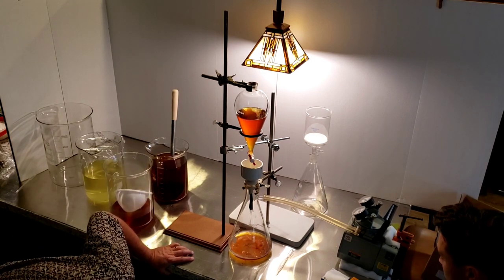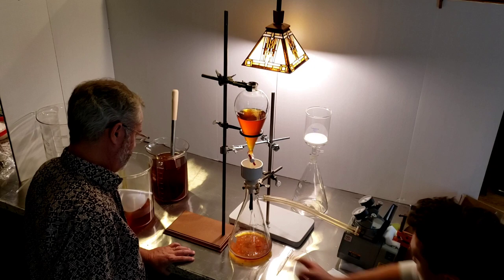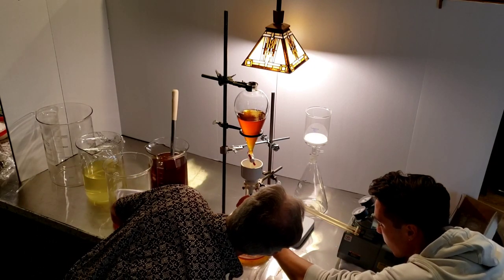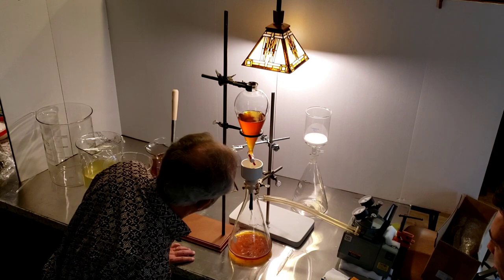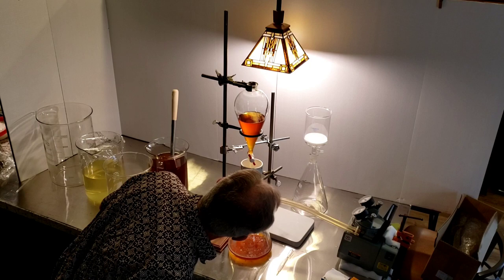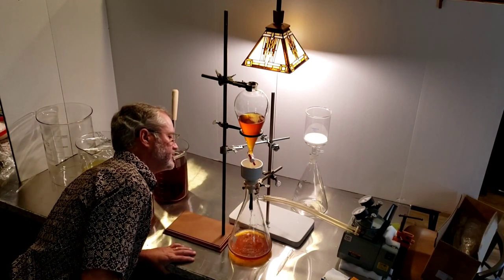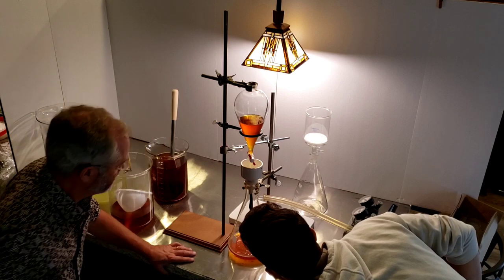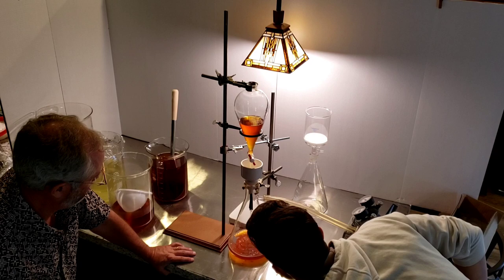Is it clean enough? Can't tell. There's too much agitation there. There's a little bit of spraying over here in this area. There's a little bit of liquid on the silver on the side over here. It looks like it's getting up here though. Good. And see what's happening — it's spraying out the side here. So maybe I should wrap that a little bit.